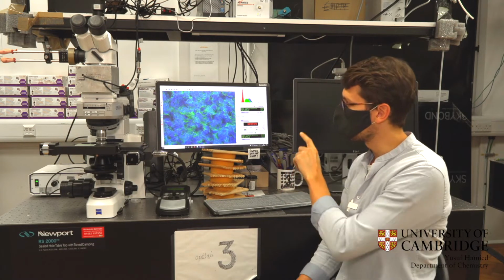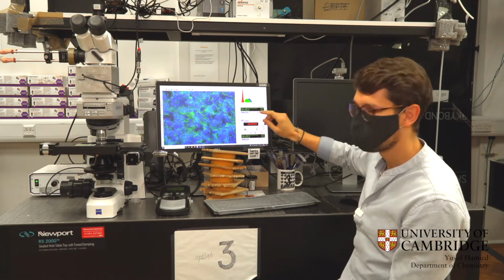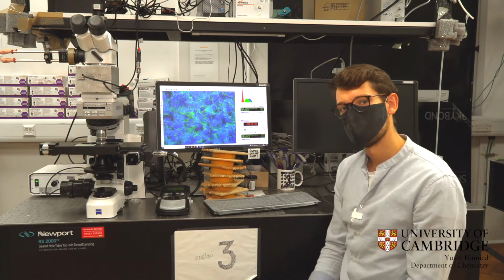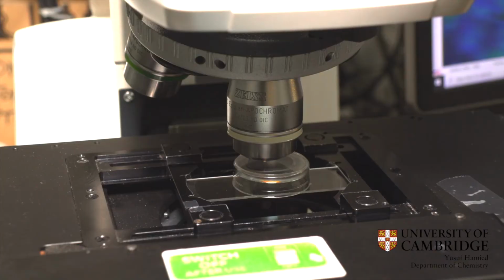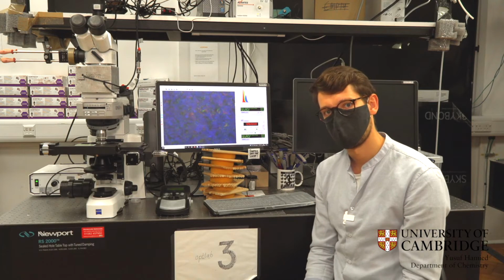And we can see that on the microscope here. When you look at the camera shot here, you can see that the film appears a lovely blue color because we're filtering for the left-handed light. But if I change the settings so that we filter for the right-handed light, you see that the film in the right-handed channel only reflects a dull brown color. And this is a response that we see in natural structures, and it's something that we can recreate in the lab using our cellulose nanocrystals.